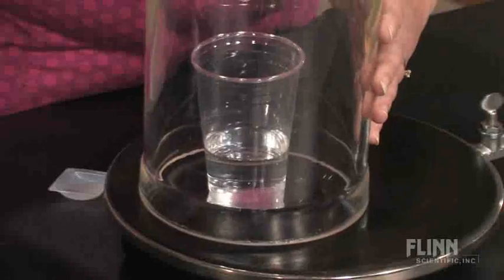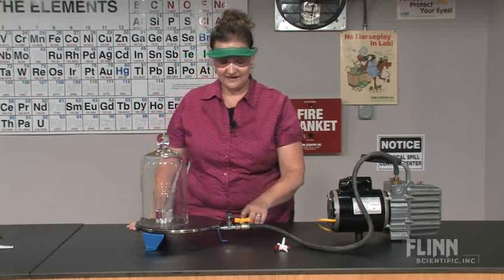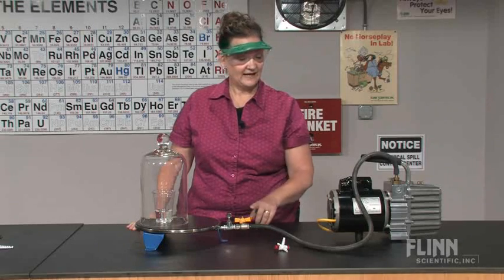Then you cover the cup with the bell jar. Make sure your valves are in the proper position, and turn on the pump.